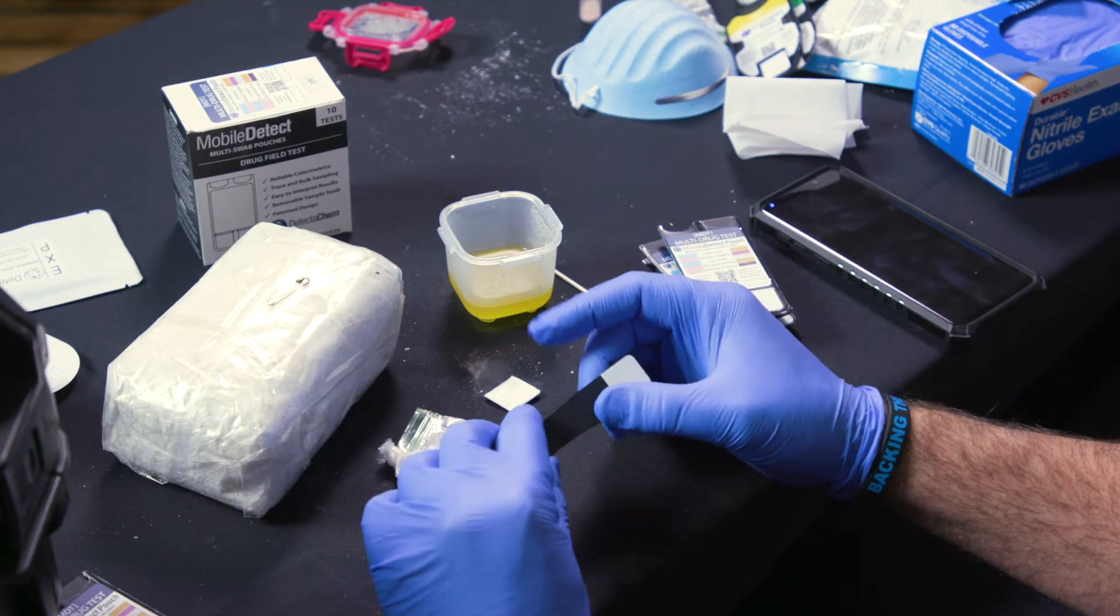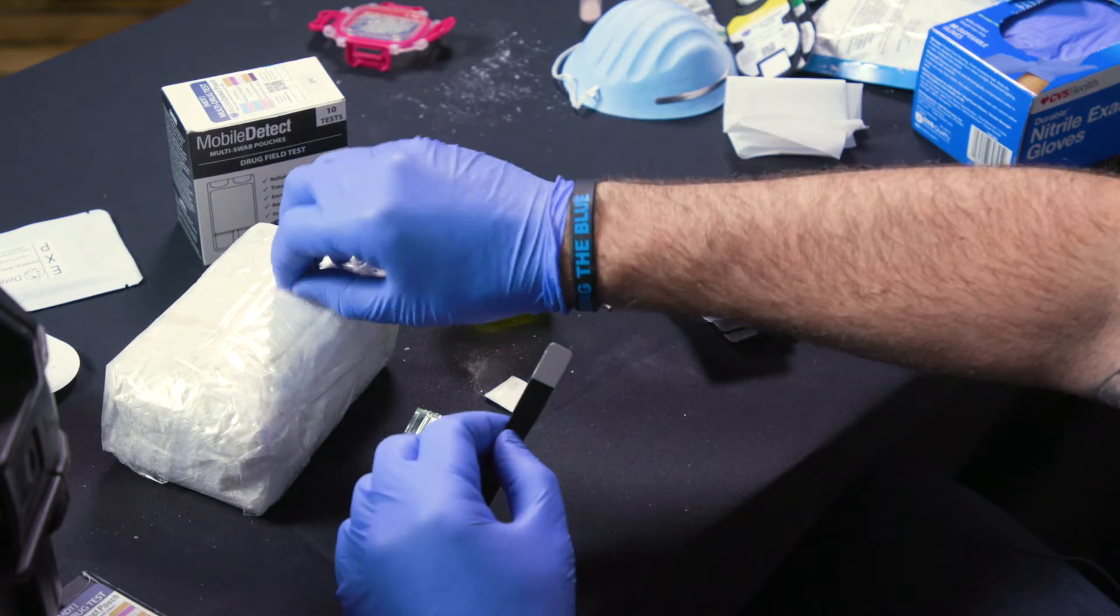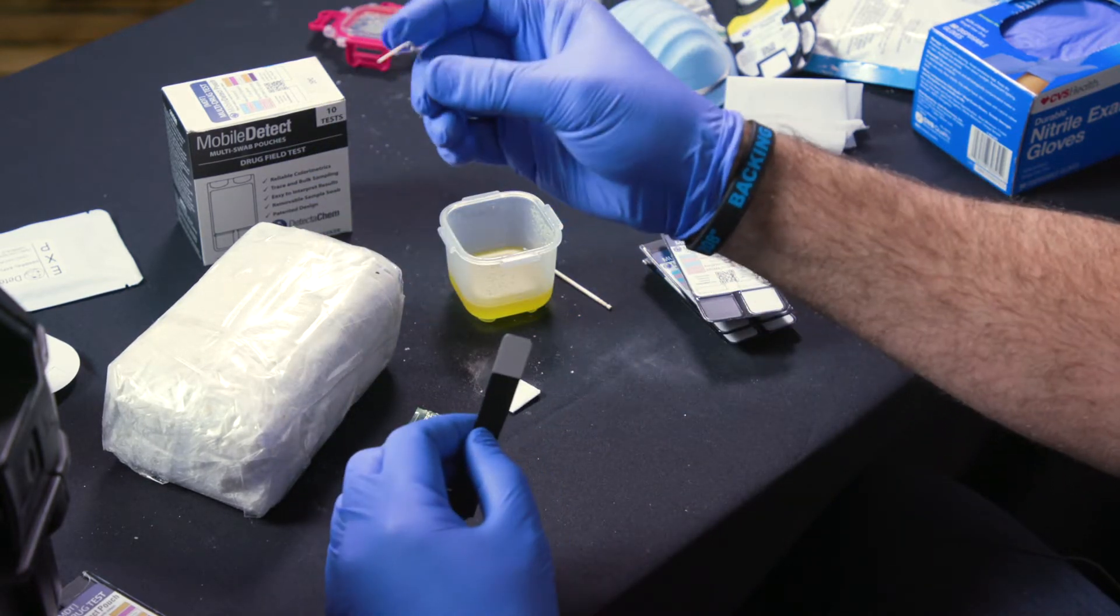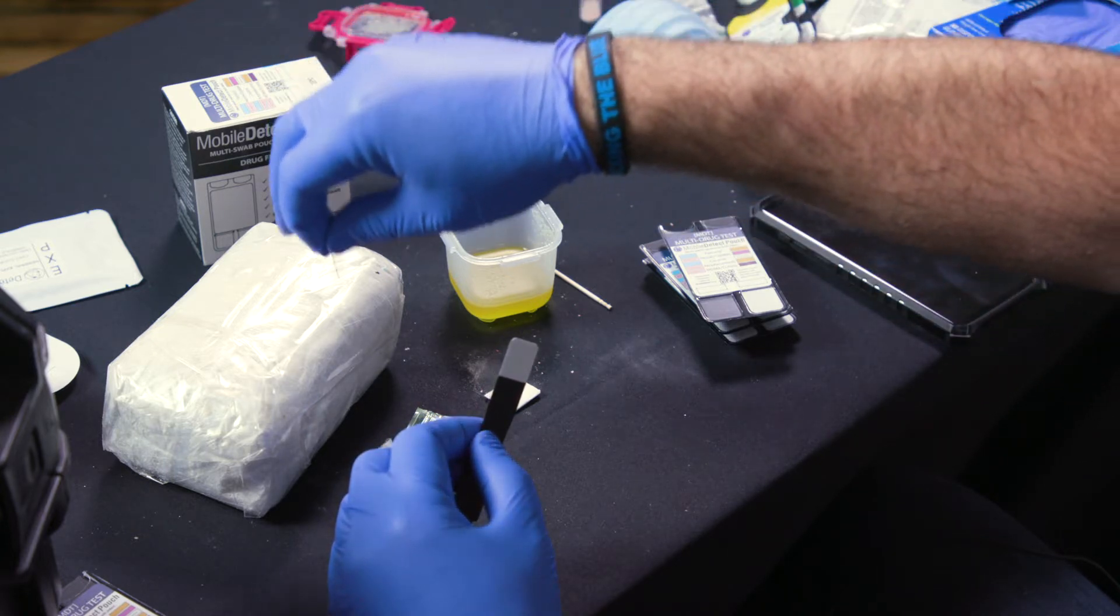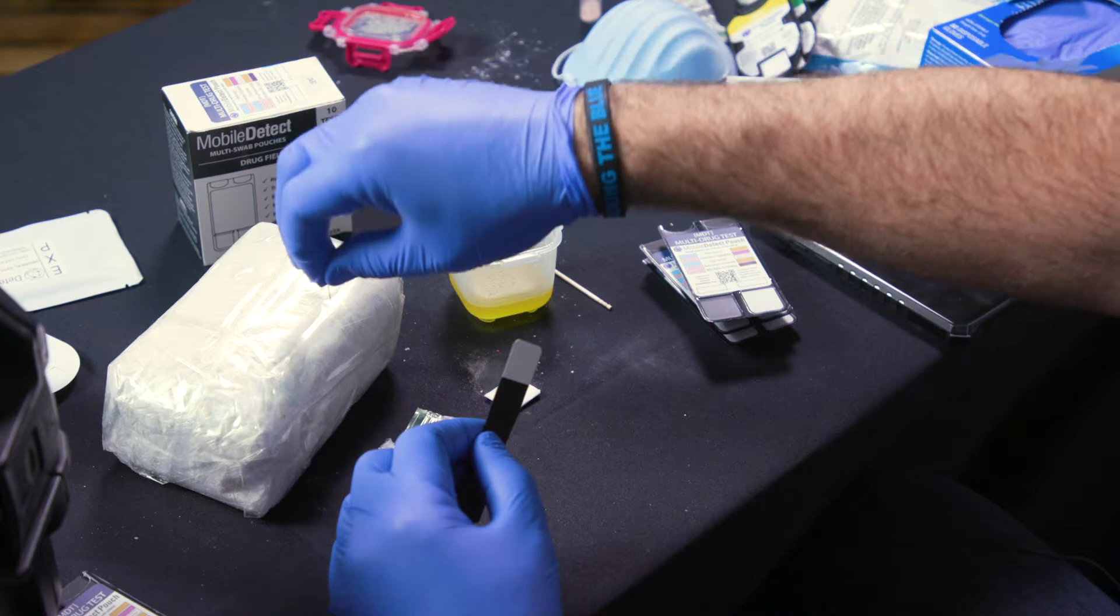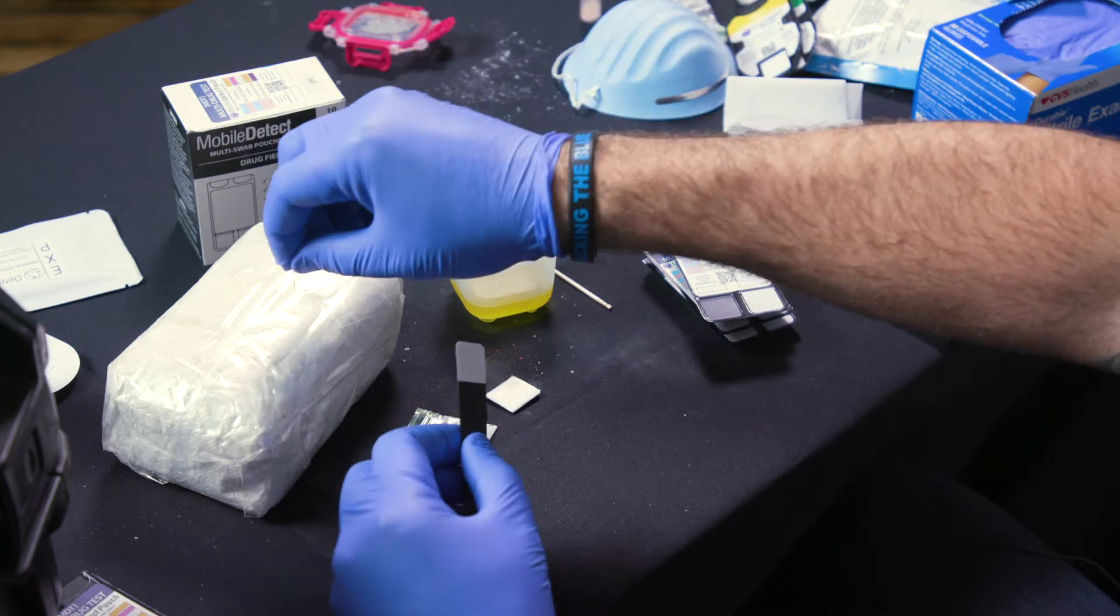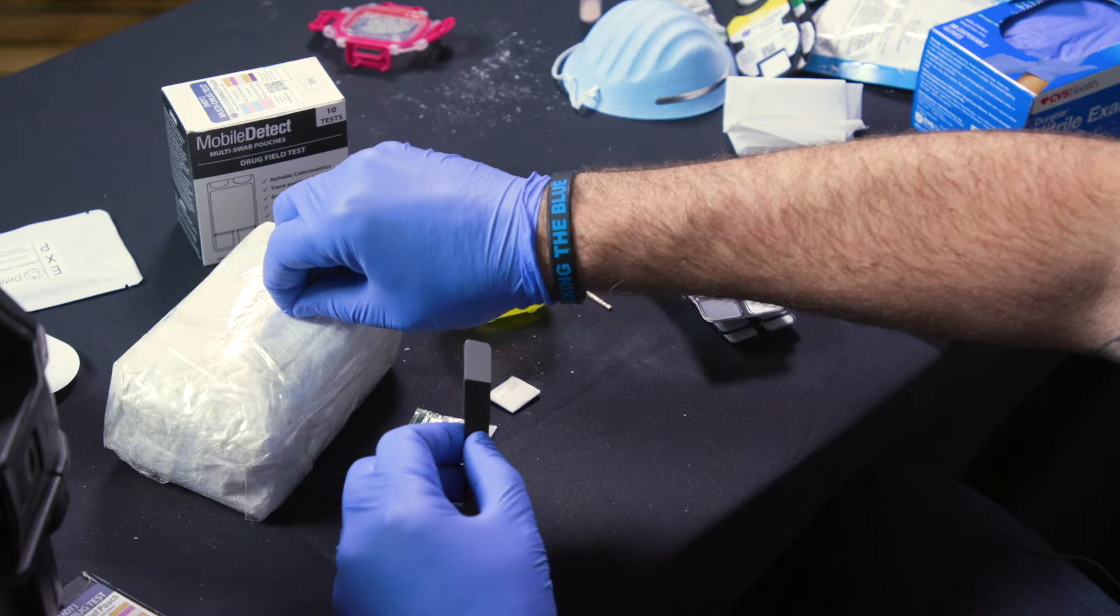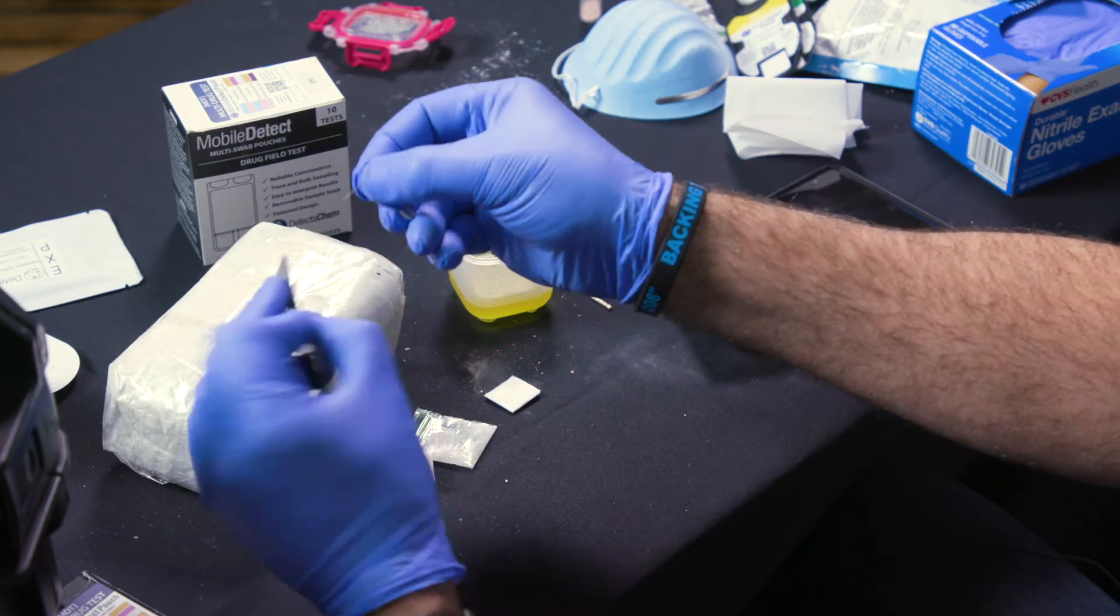So the most tried and true practice is taking a safety pin or something sharp. What you want to do is you want to be able to have something puncture down through to the actual drug or narcotic that's inside. So I take my safety pin, puncture down to the kilo, pull that out.